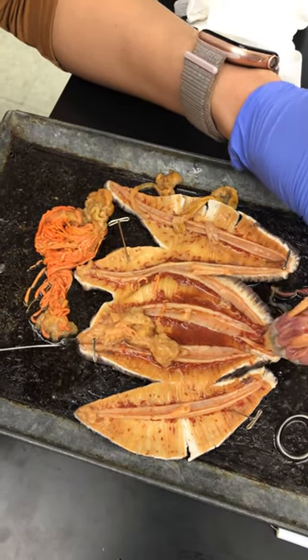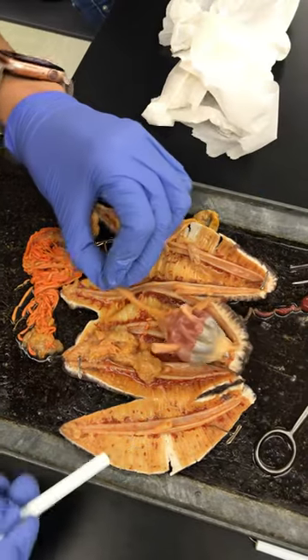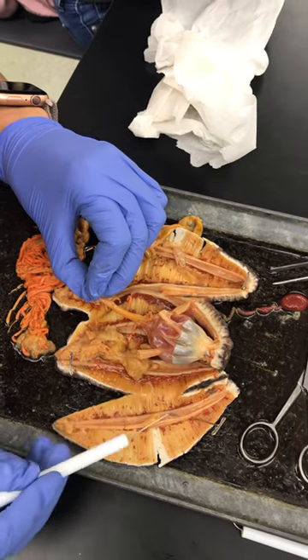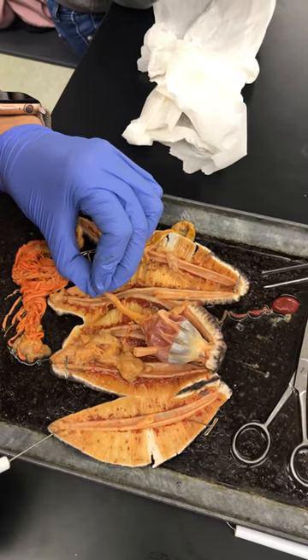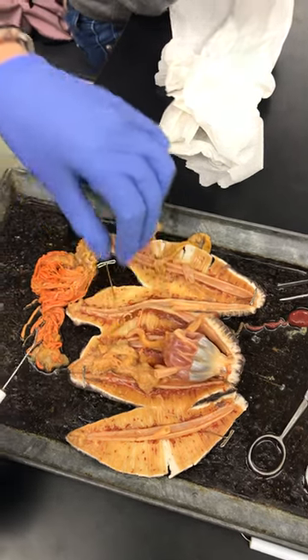Cloaca and anus would be here, and that's how you can tell when you have the esophagus. These are the longitudinal muscles. If you dissect this you can see it, but I don't know where the cloaca muscles are. It's just a bunch of mush.